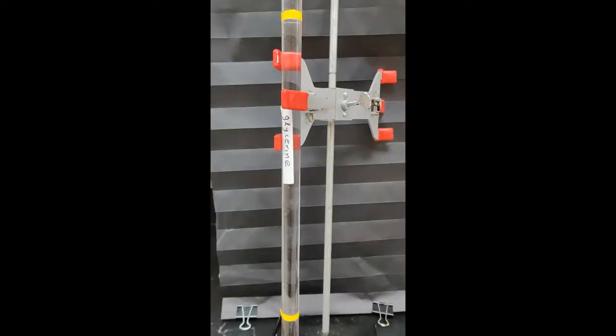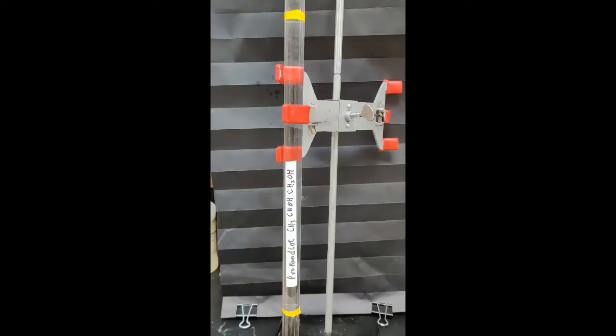So I have several tubes, of course, that have the same diameter, and I've marked off the starting and ending mark that was engraved in the tube by the company, so that, of course, we can compare the time it takes to travel a certain distance through a fluid. Now I have propane diol, and as you can see, I have again marked the starting and ending point with some yellow tape so that we can see it very clearly. And we're going to drop the ball bearing in the top, travel on down through, and we'll time it to see what happens.